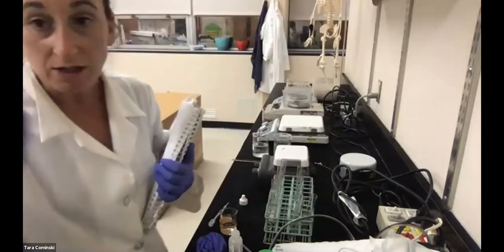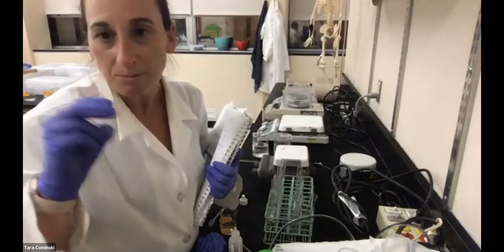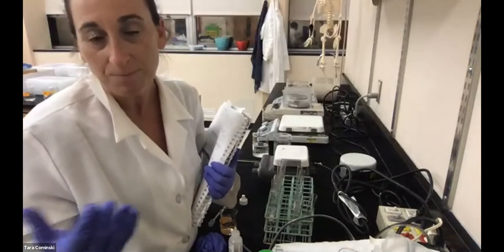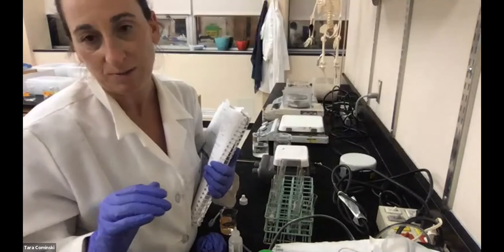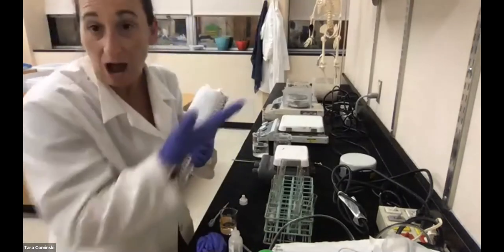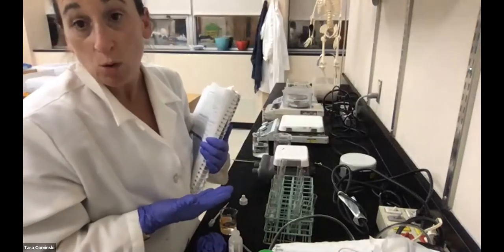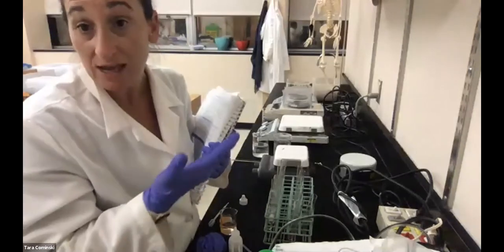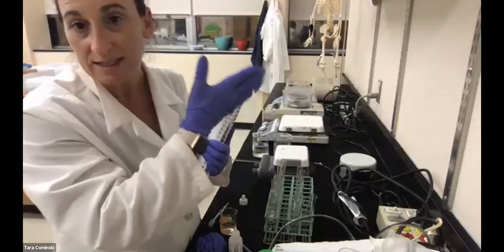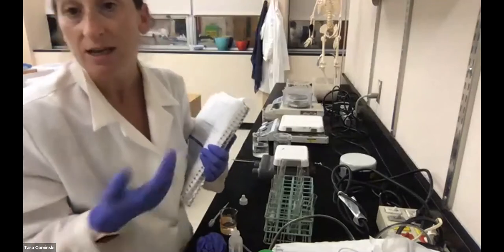Now, if we're gonna talk about catalase, its optimal pH is probably around 7.2, 7.4. So we're gonna go with that. If we're gonna make a hypothesis, we would hypothesize that the enzyme activity, or the bubble column height, would be highest at the pH of 7, and it will be decreased at the pH of 3 and also decreased at the pH of 10. Okay, so let's see what happens.